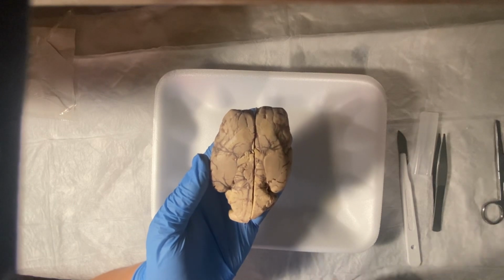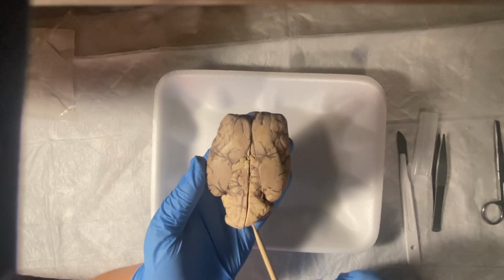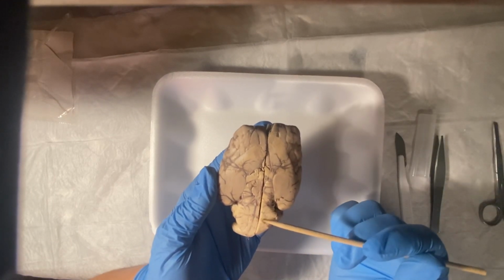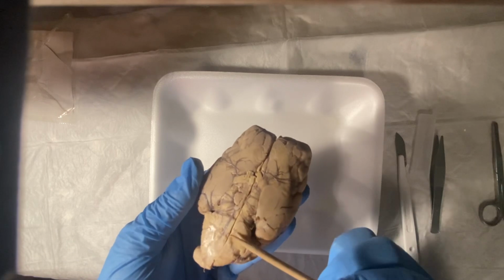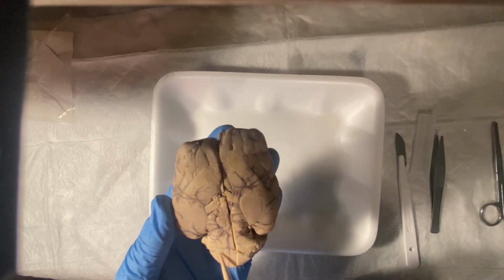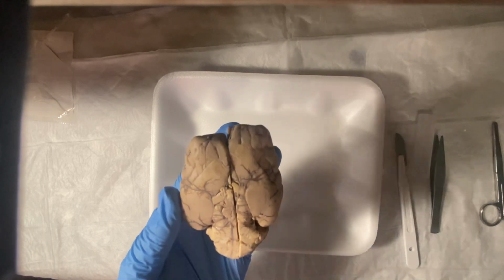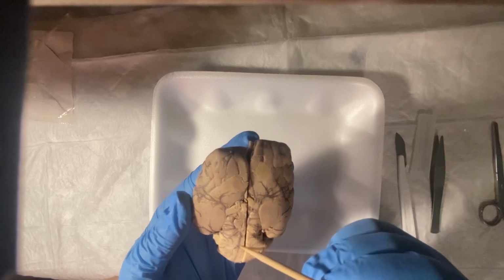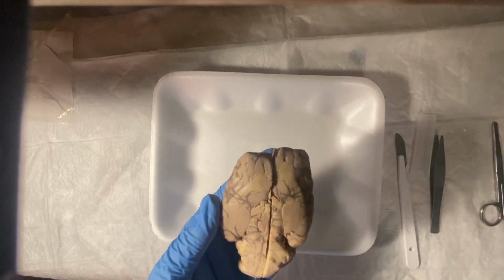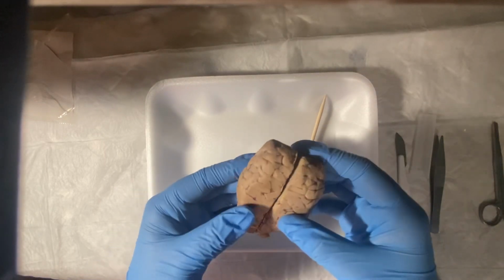And lastly, we have cranial nerve number 6, which is the abducens nerve. And those are very tiny. And let me see if I can kind of, I got one right here. Can you see that? One right here. And then the other right here. Oh, no, I'm wrong. That's not it. But it is around here. But yes, and that is the abducens nerve. And that's all the cranial nerves. I believe that is covering everything.